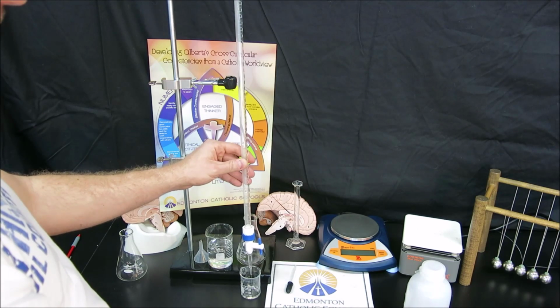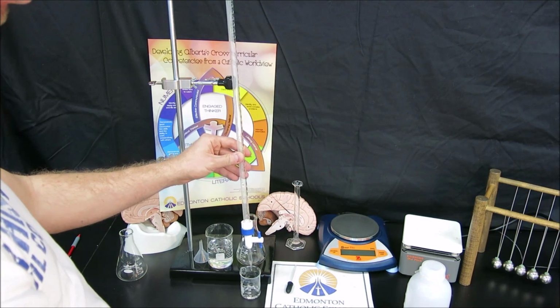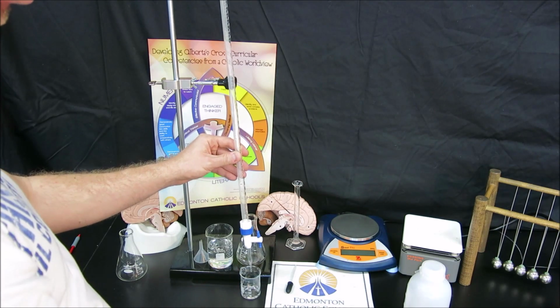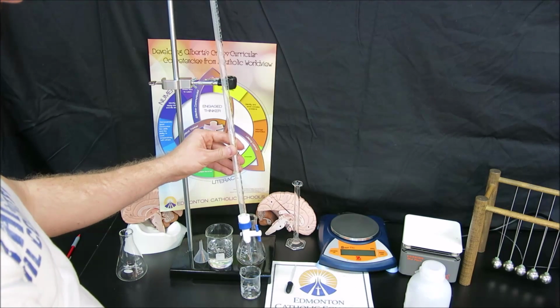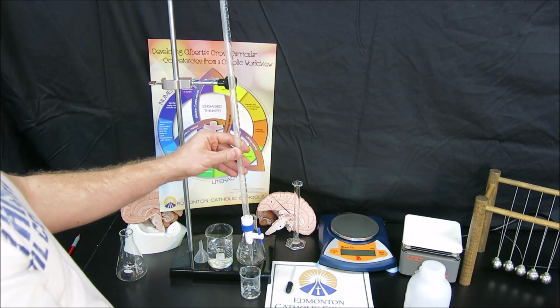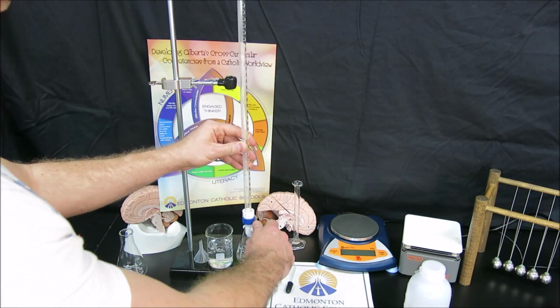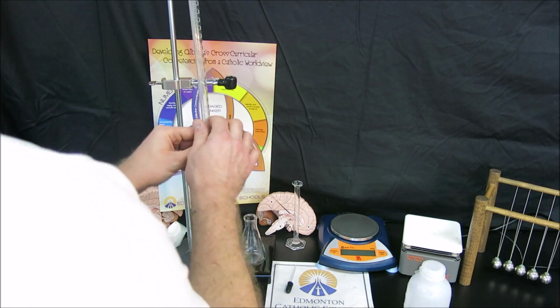Now, when the rinse is done, there will be a little bit of water left in the tip. And if I just went ahead and titrated, leaving a little bit of that water left in the tip, the very first amount of titrant added will be slightly diluted because of that. So the second step here is to do a titration rinse with the titrant. So we're going to close it off again, perpendicular. We're going to gather our titrant.